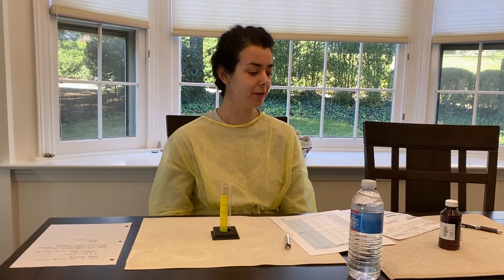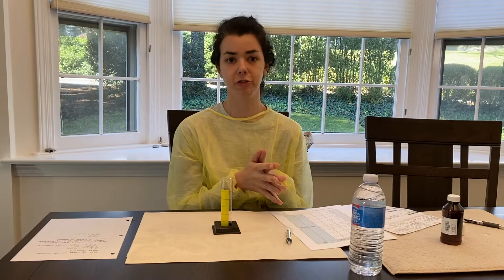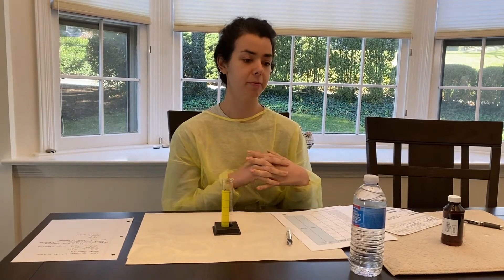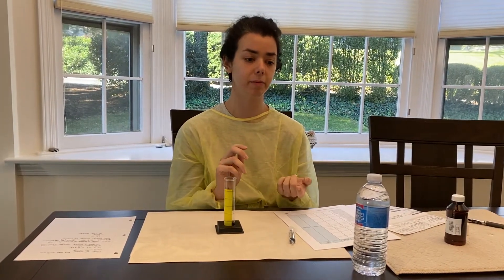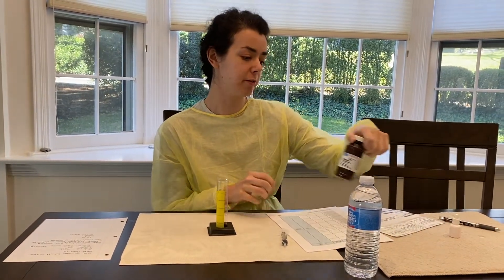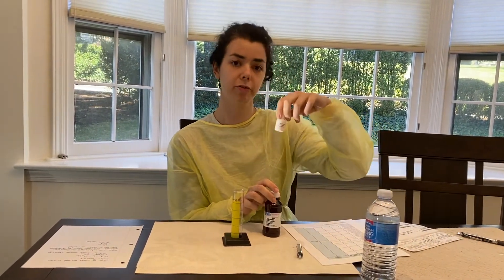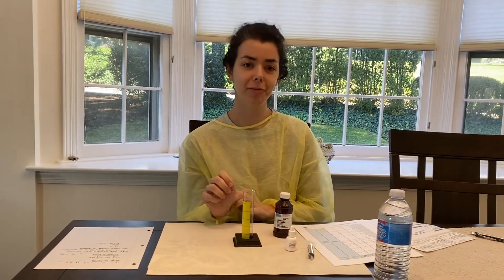Hi, my name is Lauren and today I'm going to be going over Practical Skill Lab 4, which involves properly reconstituting a pediatric suspension for a patient. After I prepare the medication, I'll be having a consultation with the patient's guardian because it is a prescription prepared for a child. You'll see me properly utilizing the aseptic handwashing technique and properly dispensing and formulating the Zithromax prescription, and I'll also be adding some orange flavoring. So without further ado, let's begin.